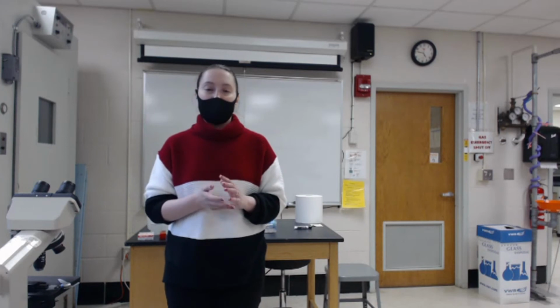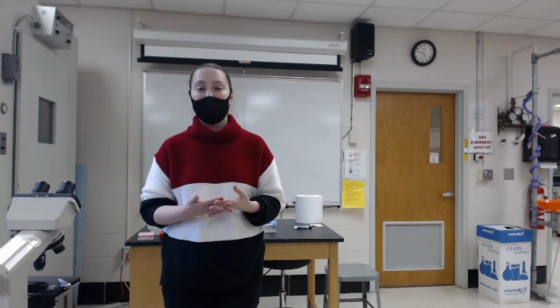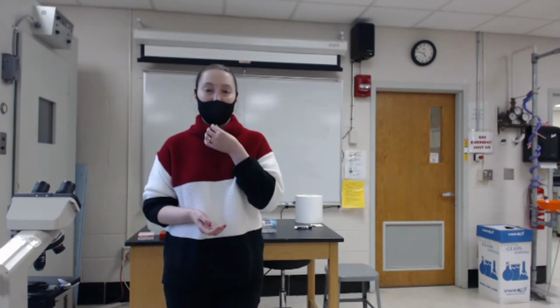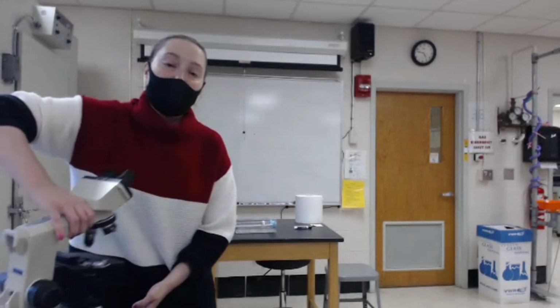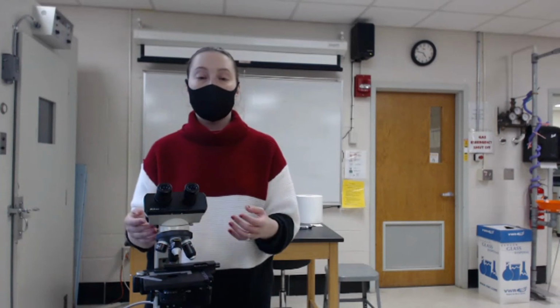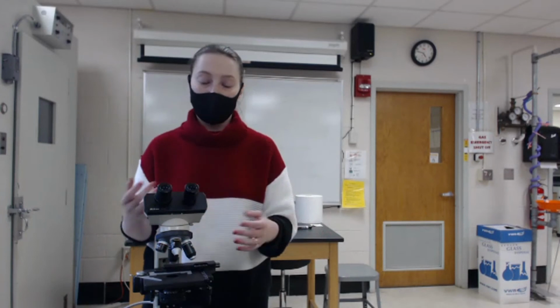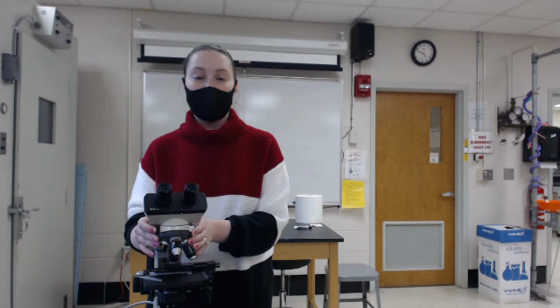It really boils down to this: oil immersion lenses afford us the ability to have high resolution while having a high magnification. Most of the lenses we've worked with in the past, especially if you've taken anatomy or mammalian anatomy, are designed to work through air as a medium. We've used the scanning power, low power, and high power to view histology slides or other types of slides in our previous courses.